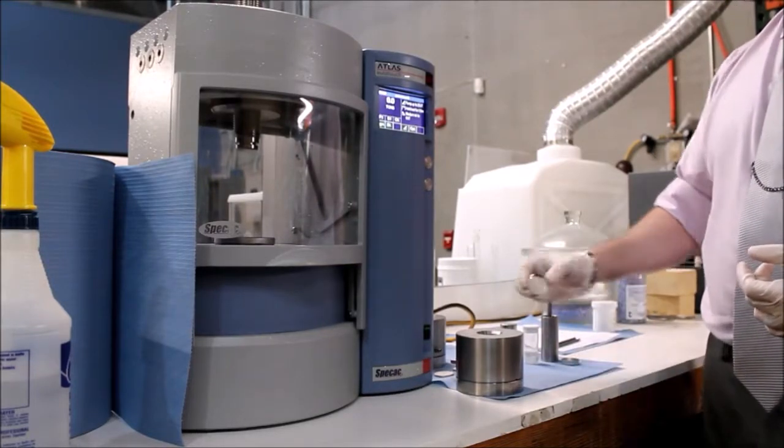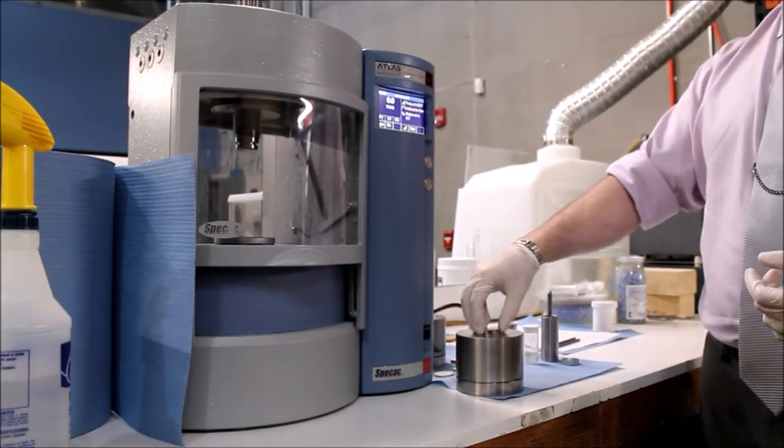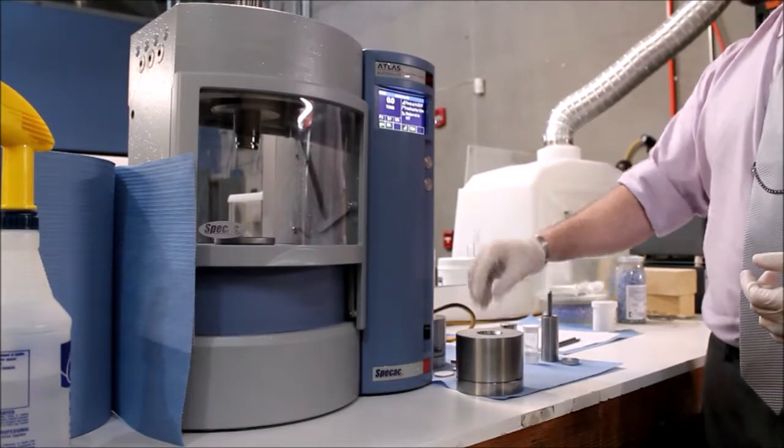Once complete, carefully place one of the pucks into the bore of the cylinder, taking care not to jam it inside.